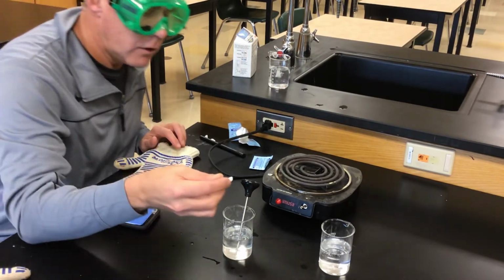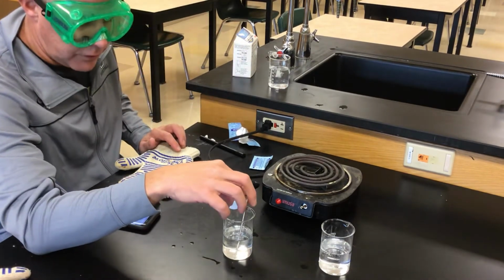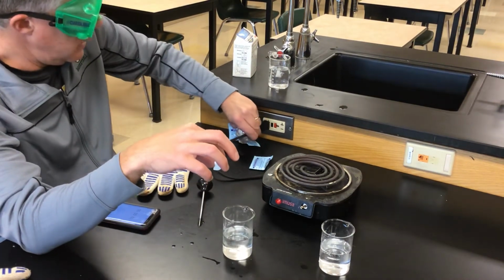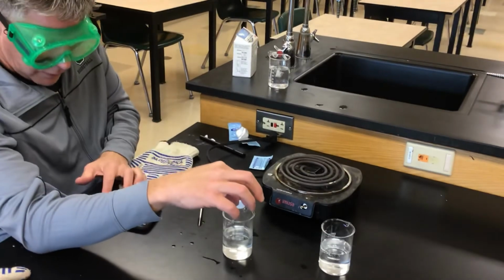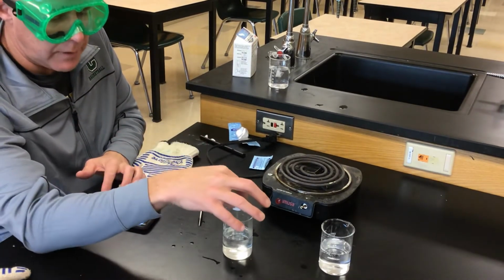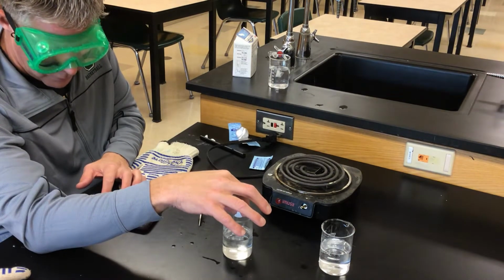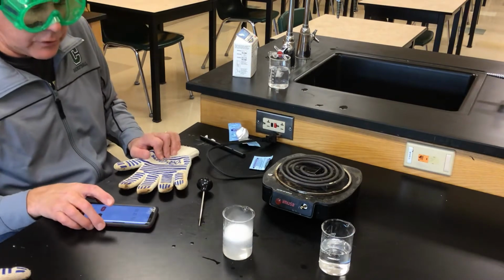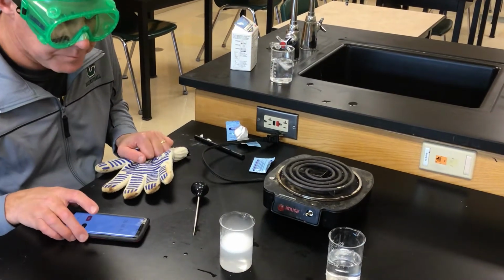I will dump in the Alka-Seltzer here. Oops, take this out first. Unplug my heat. And if you think about this in your head now, what's happened, you might have some sort of hypothesis about this one. So I'll drop it in and hit start. And again, it's cracking along pretty good.